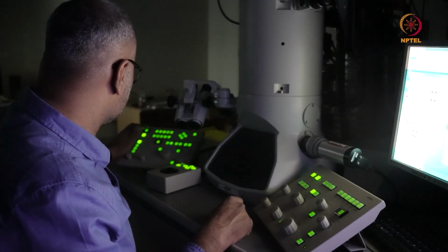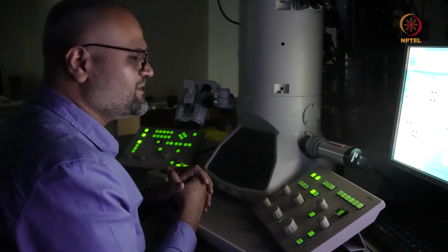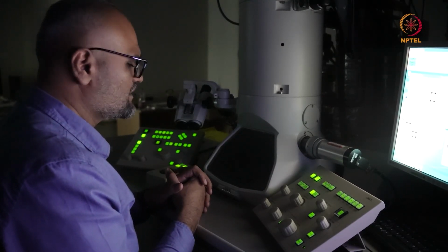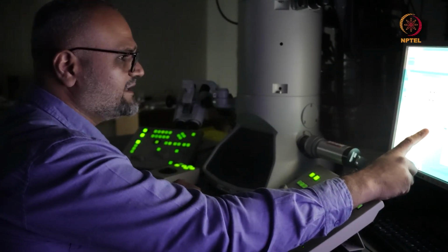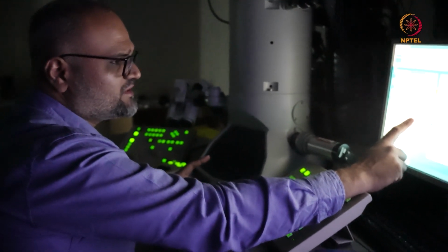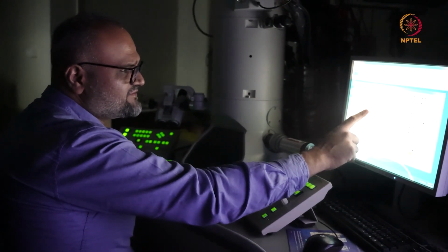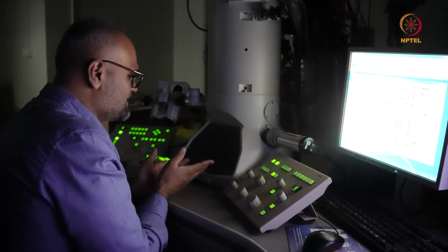To switch on the beam once the holder is inserted and all the vacuum values are ready, I have to press this button here, and you'll notice that the illumination would start. So as you can see, the extraction has started. This is a thermionic emitter, and it is shown in percentages here. We've set a limit of approximately 59.6%. So at some stage, the illumination should start. On switching on the beam, you'll notice that you'll have some illumination on the screen here.